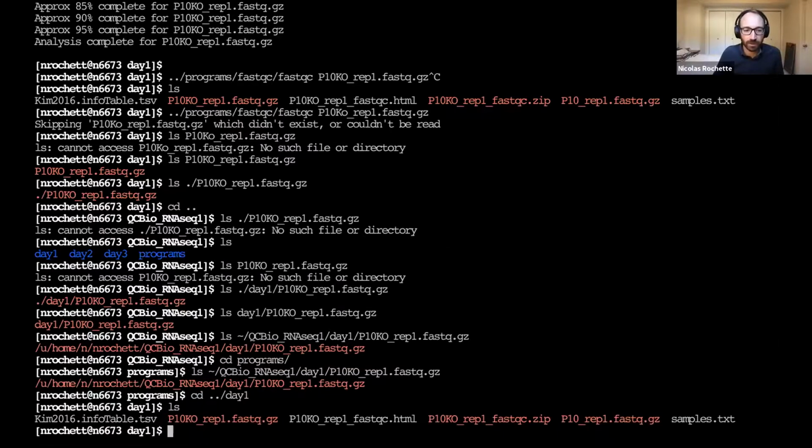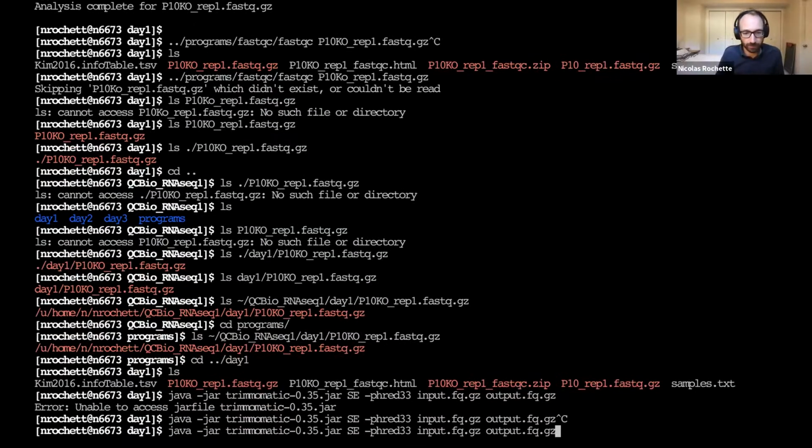Oh, one thing I can mention regarding rerunning it for another sample is we're going to get into the same sort of issues, where it's very easy to mix up what we're doing with the input file and what we're doing with the output file. And so, for instance, what may happen is, if I go back to my terminal, and then, yeah, I see what you mean.